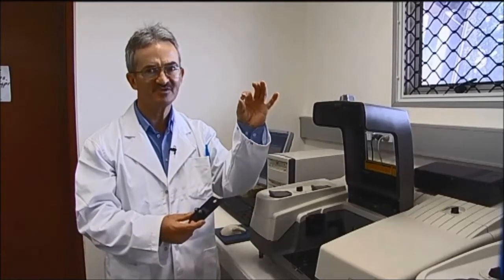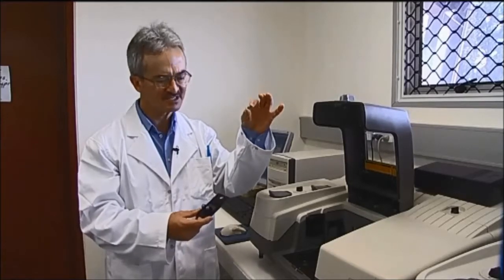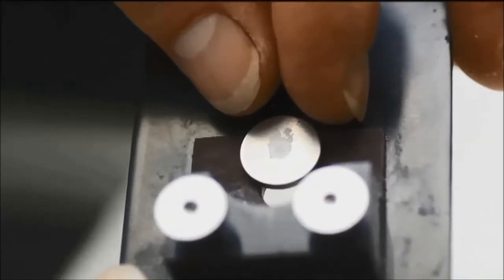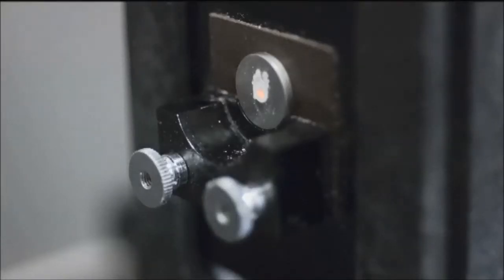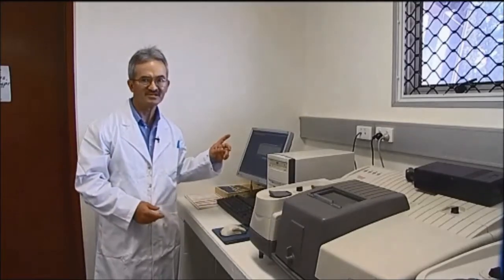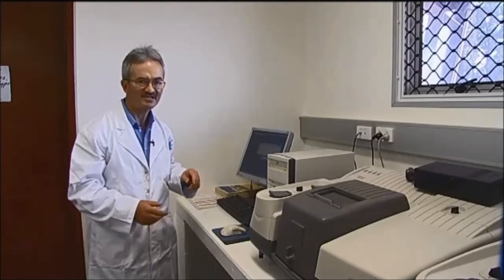Here we have a sample prepared in a potassium bromide tablet. We put the sample inside of the holder — this is the holder with the KBr tablet — and then we put the sample inside of the infrared spectrophotometer. We close it and then proceed to record the infrared signal of the particular polymeric sample.